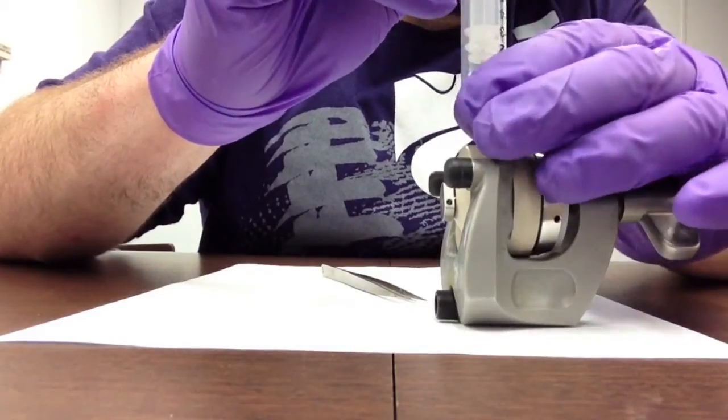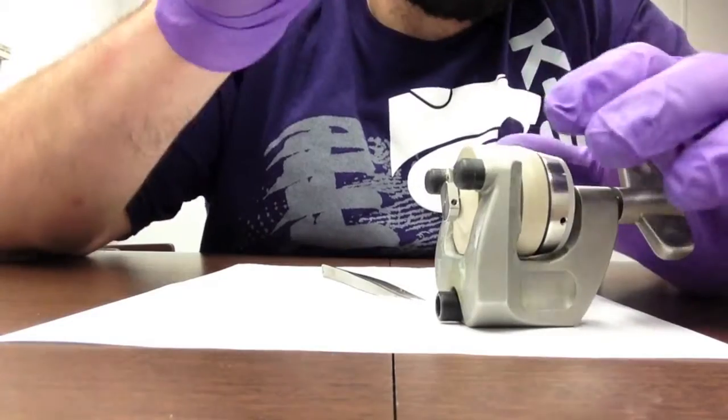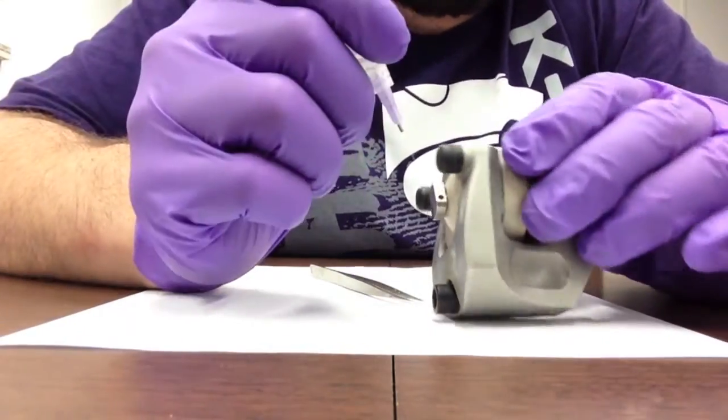We push the syringe and push out the lithium into the hole. I do this once or twice to get a good amount of lithium in the hole.